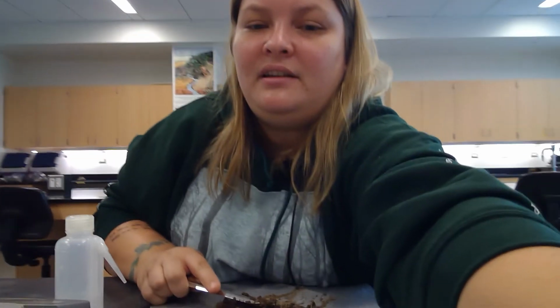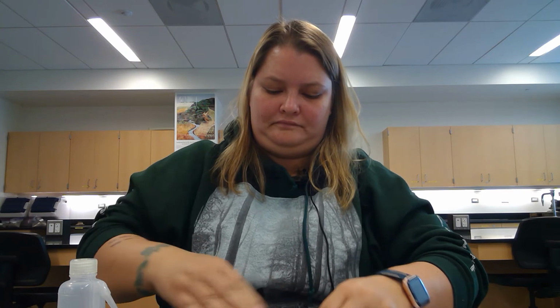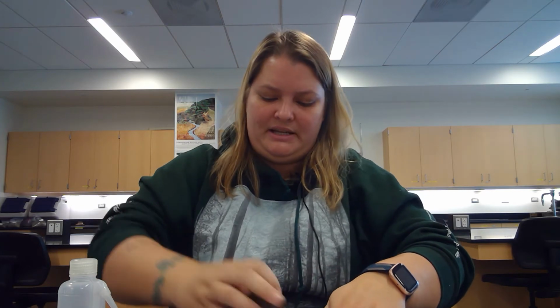So that is what I'm doing, even though you can't really see it, using my fingers.